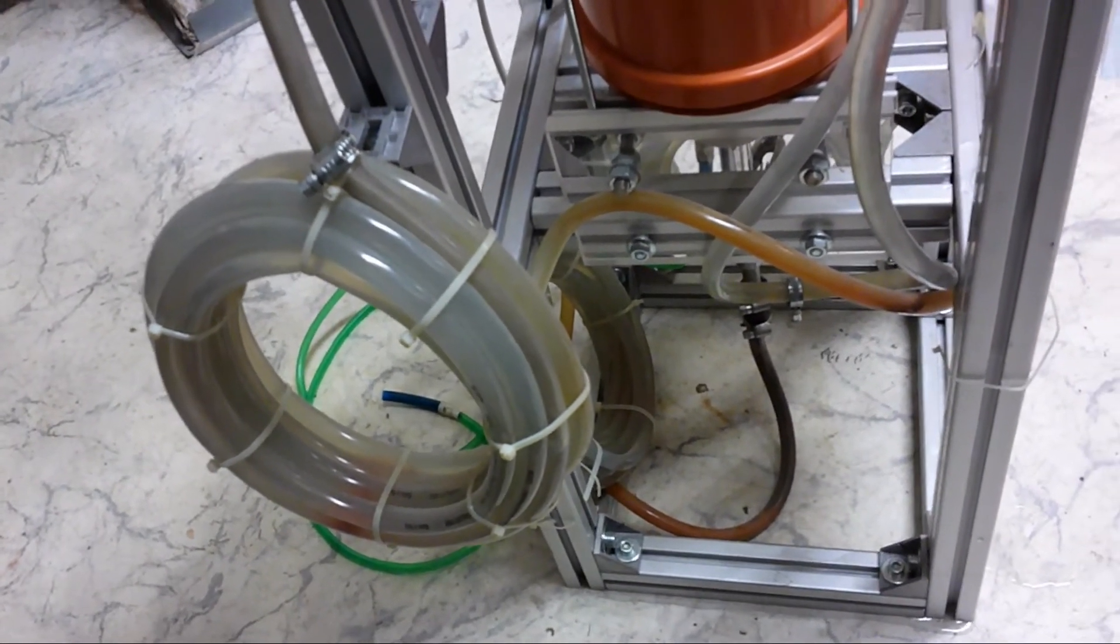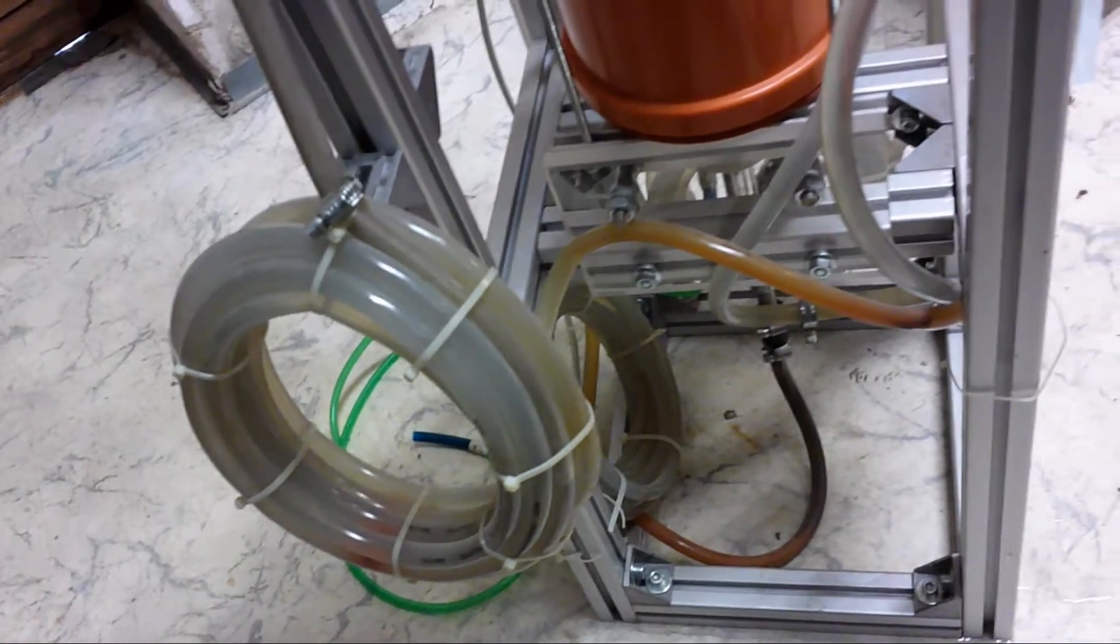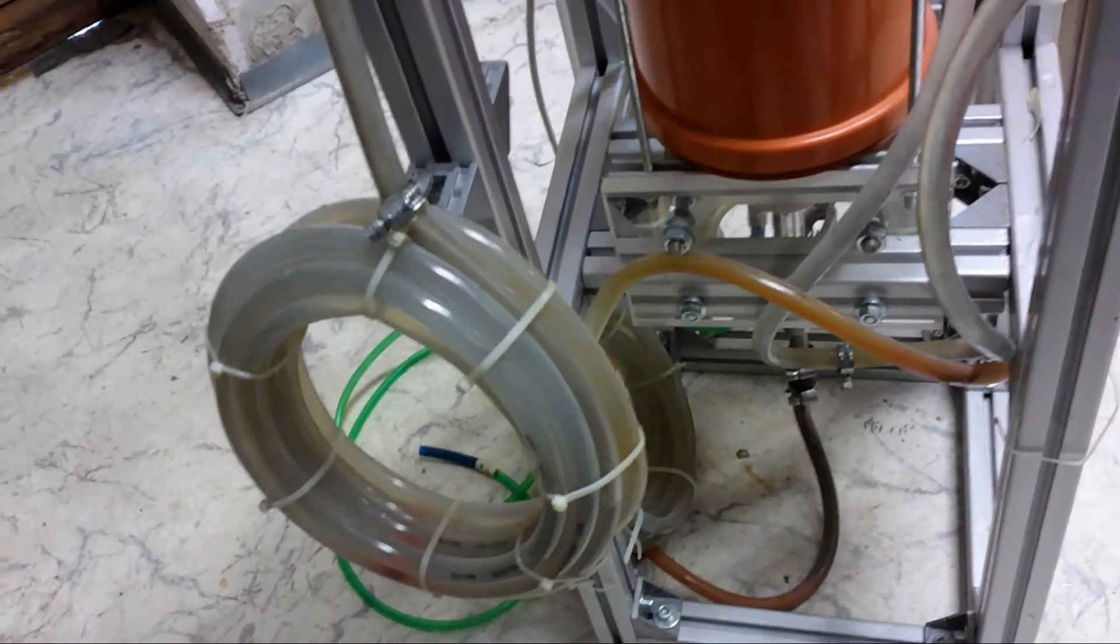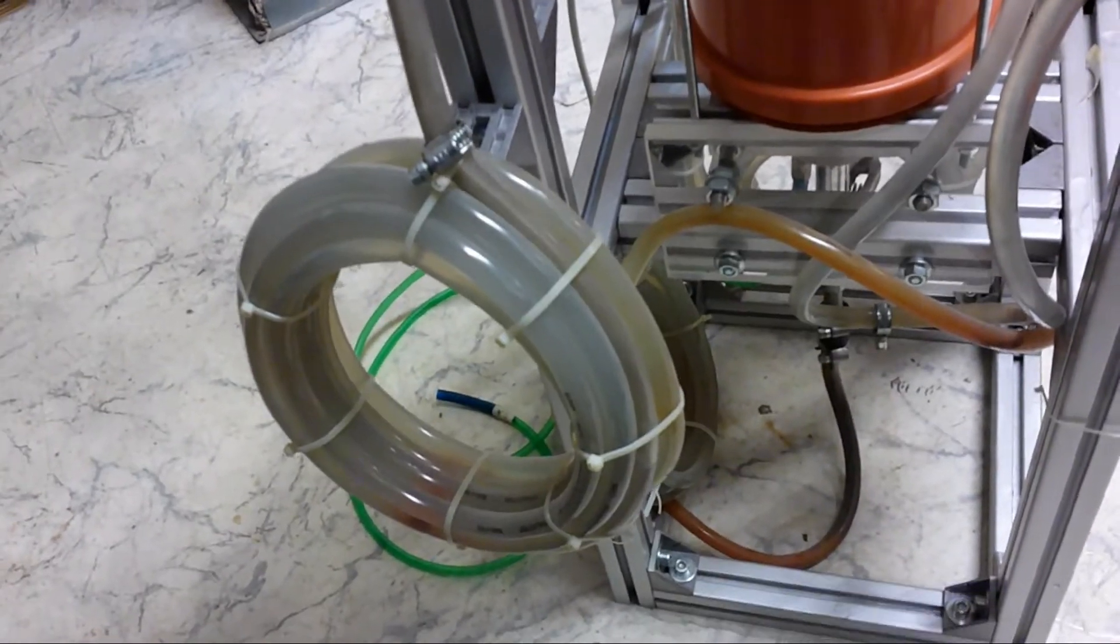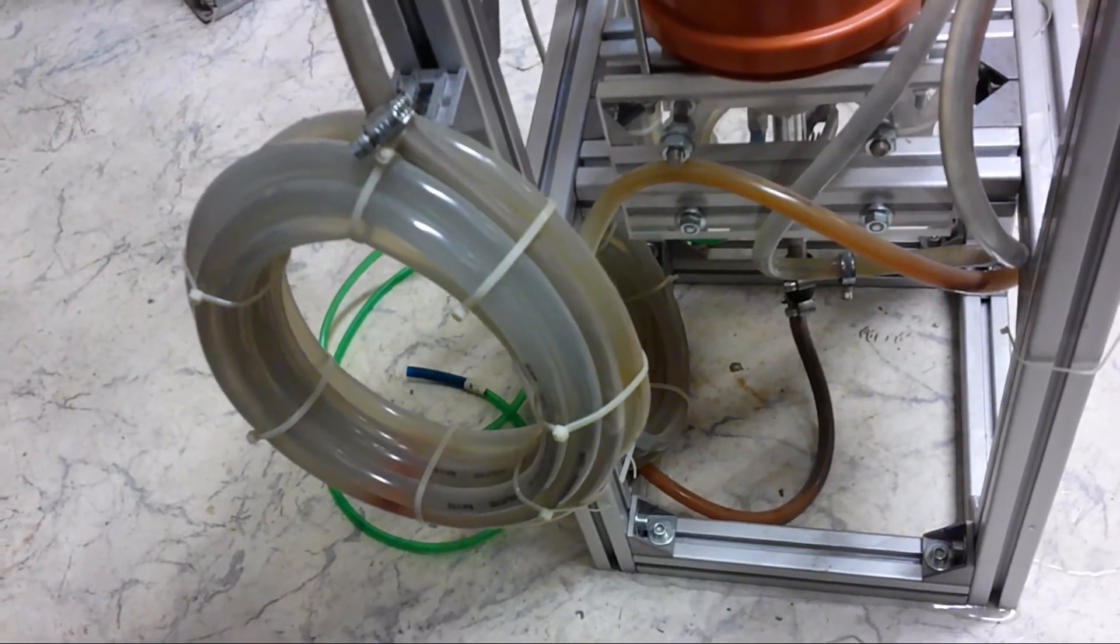That's basically the reason for the long tube. But I am not really sure how I will do it in the future when I reassemble the whole thing, if I will do oil cooling or if I will use the same system. We will see, I need to think about it.